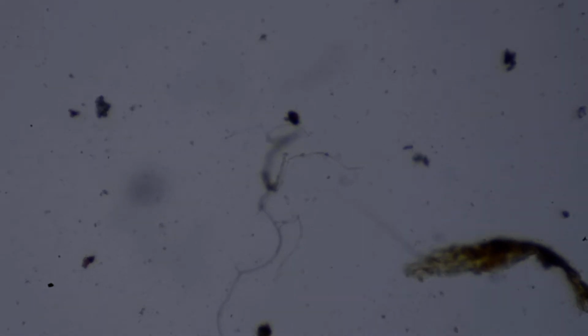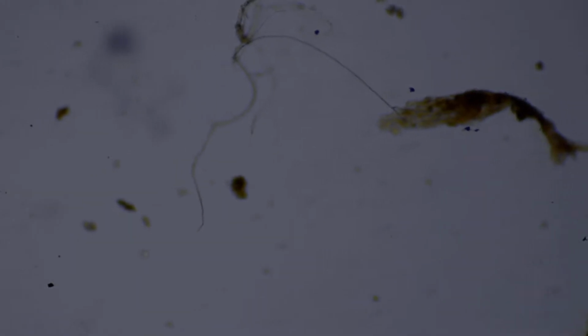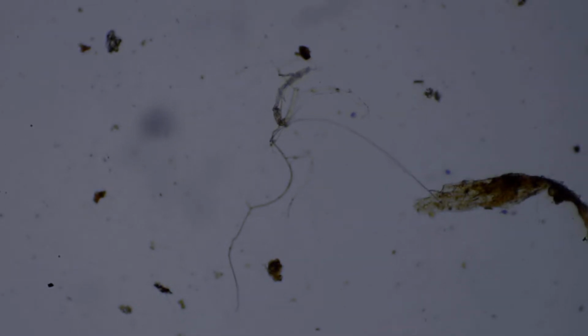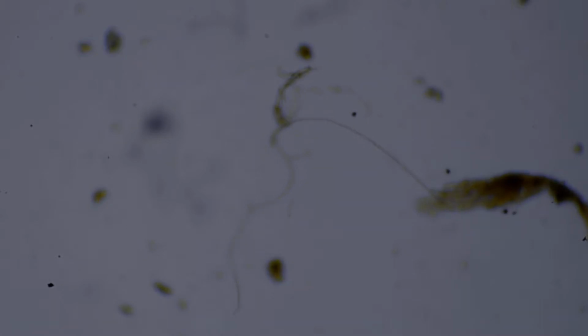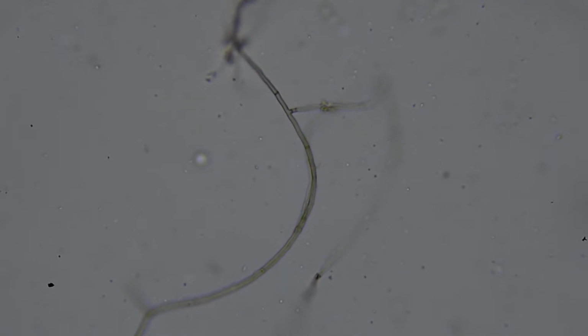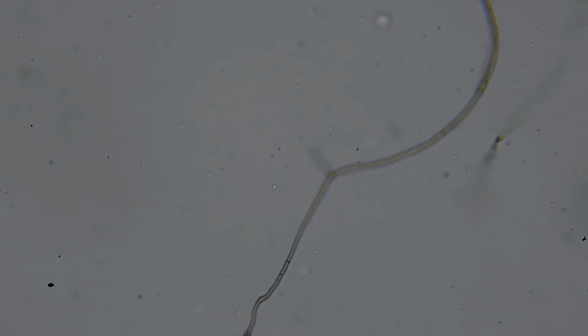This fungal strand in front of you looks to be a fairly beneficial one. We've got a number of characteristics that we use to define either beneficial or pathogenic species of microbiology. One of those, for example, is the cross walls that you can see, called septa in fungi. Once we zoom in here, you can see the little divisions in between the individual cells. So there we go, you can see that little septa there, all those septa running down the middle of the fungi. Each one of those divides represents a single fungal cell, basically.